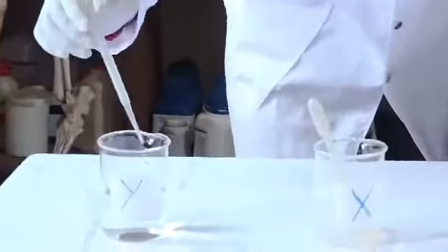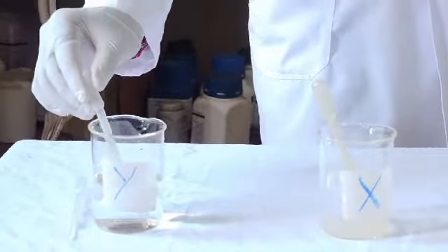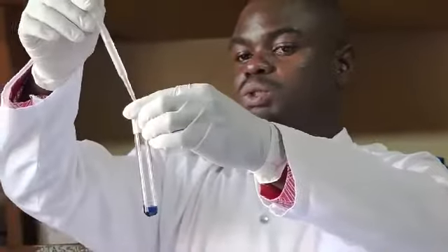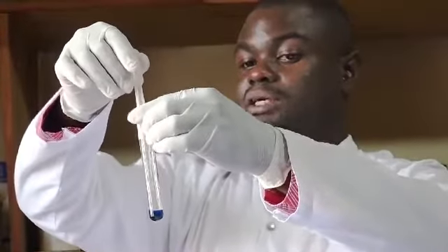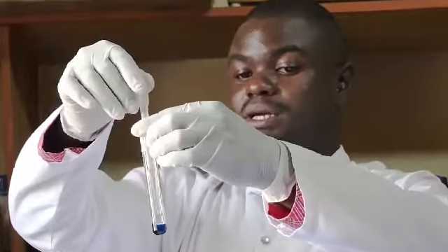I get my solution Y. Direct the dropper towards the inside of the test tube. Then I release.